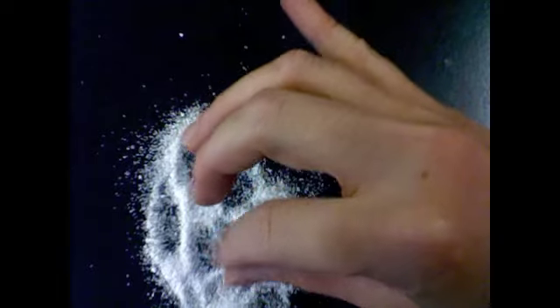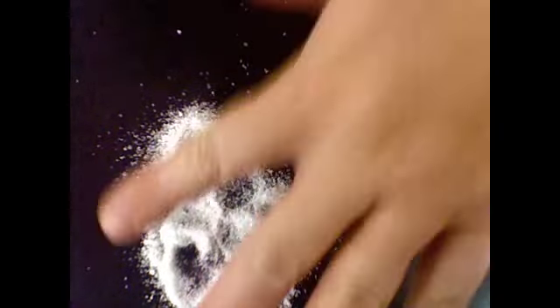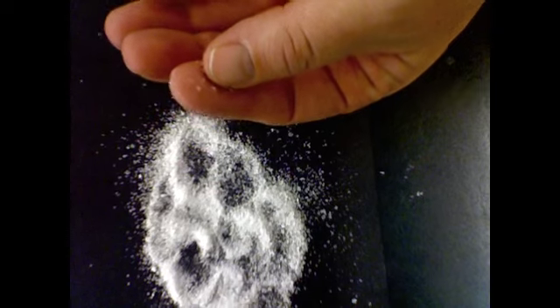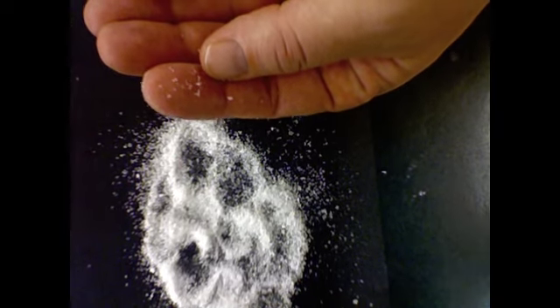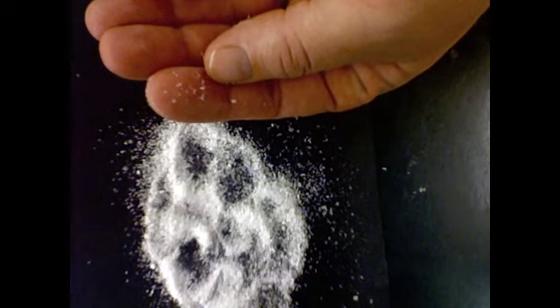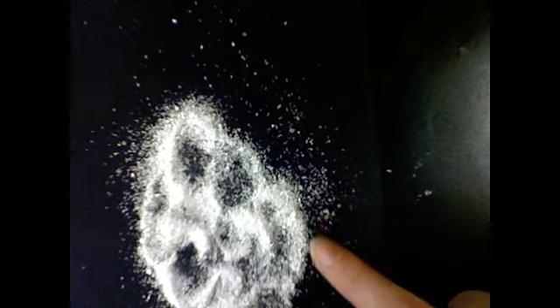Although I was able to kind of break it up into smaller pieces when I rubbed it, but it does have that pointy, sharp feel of sand at the beach. And I can see pieces of it without a magnifying glass. And some pieces are definitely bigger than others. There are some bigger pieces, and then some really tiny ones too. Like there's a big chunk right there. So I wonder if we can break it.